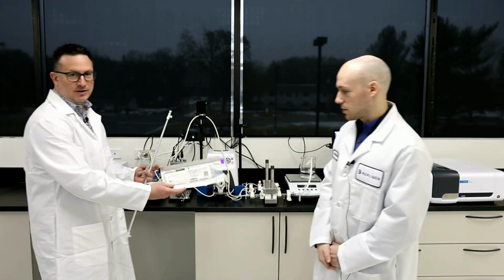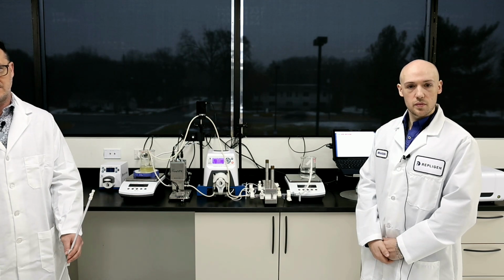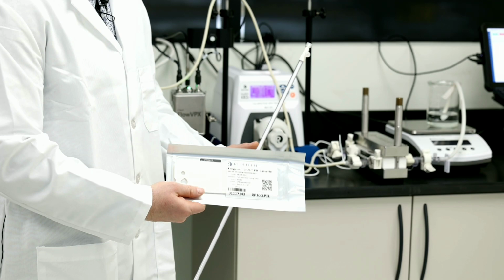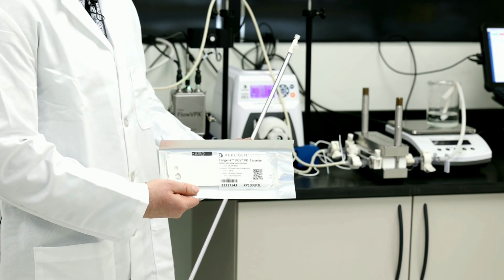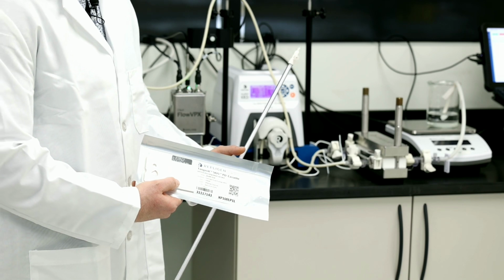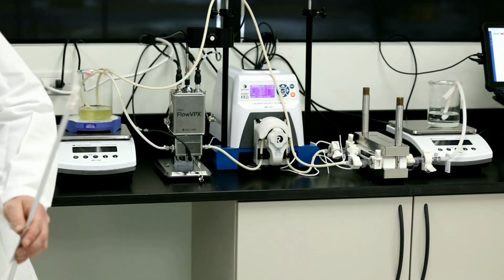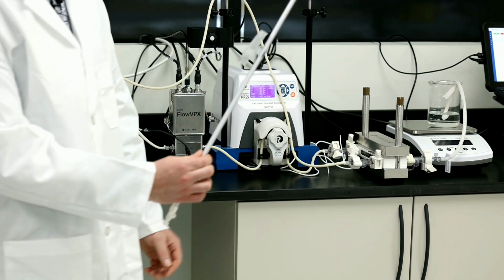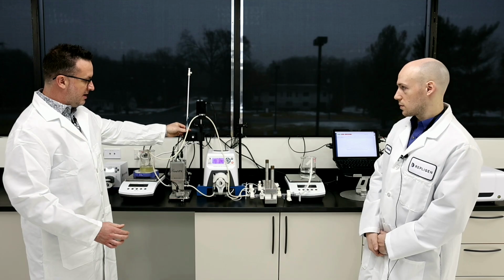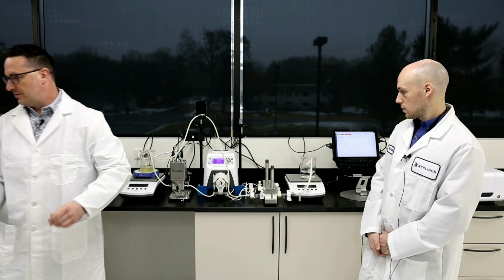Absolutely. So what you can see here is I'm holding our Tangential flat sheet cassette. These come in, as I mentioned, in a wide range of pore sizes as well as surface areas. This one's 100 kilodalton, 0.01 meters squared. Brandon's using a 0.02 meters squared filter. And then we've also got our hollow fibers here, which you can basically put into this holder to set your cassette here. So again, offering both systems.